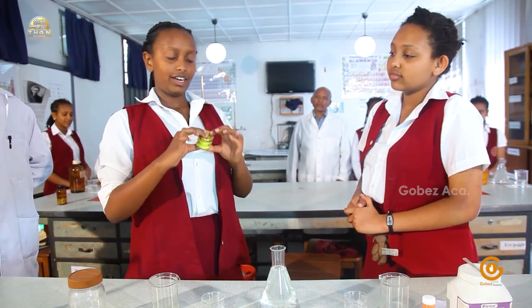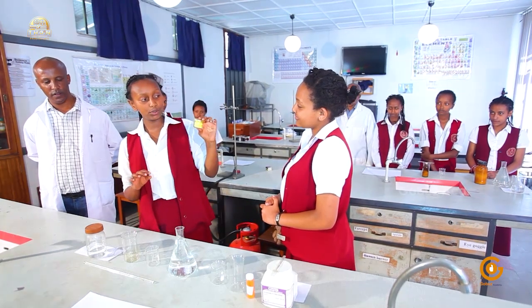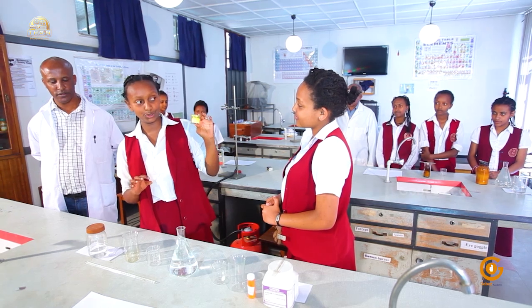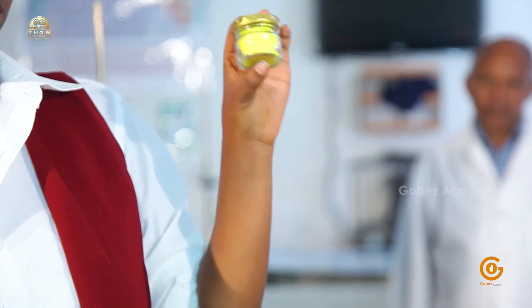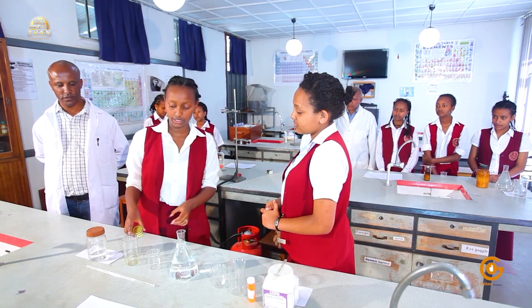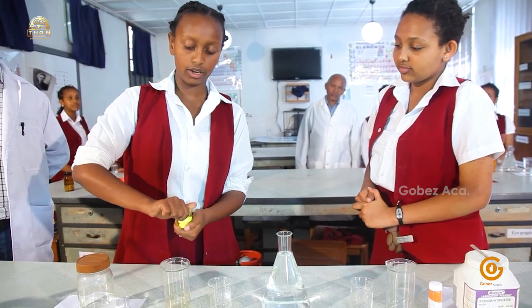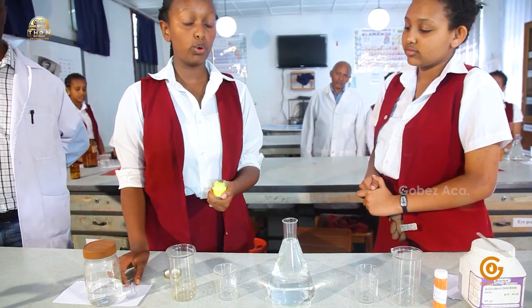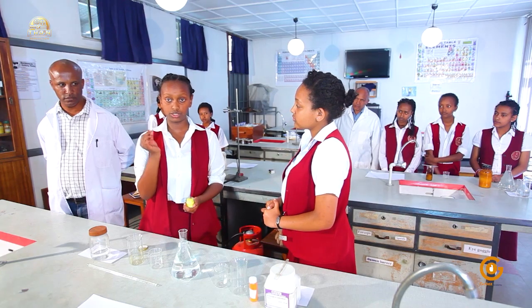Now I have here, as you can all see, a beautiful potassium chromate. This potassium chromate is in solid form and it has a beautiful yellow color. Now I need to make a solution out of it, so I'm going to pour it into my beaker. Now the beaker, we're going to use it in this experiment as chemical reactions are going to take place in the beakers. So I'm going to take it and when we are making a solution, we always put the solute first. So I'm going to scoop it using my spatula.